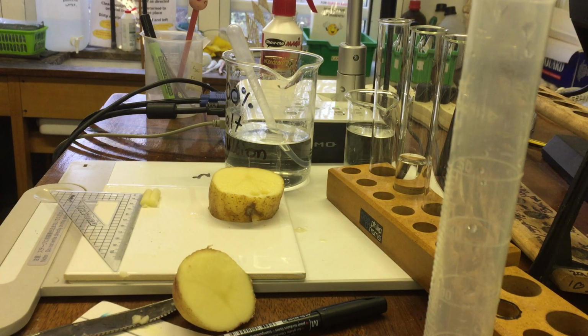Before you weigh them, you've got to do something before you weigh them. What do you think one problem is? Because they've been in the liquid, what do you think the problem might be? Yeah, guys, they might be wet, so you need to just roll them a bit. Don't squish them, but just roll them lightly on the paper towel to remove the excess water on the surface. Okay? And once you've done that, you'll hopefully then notice a difference.